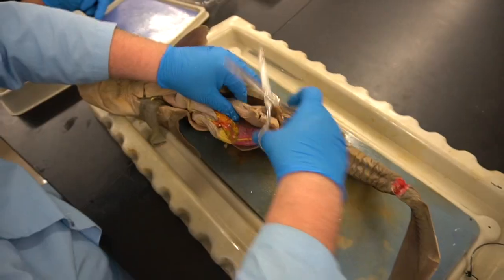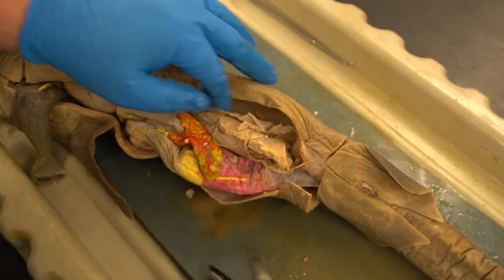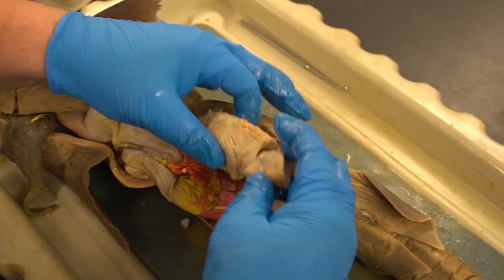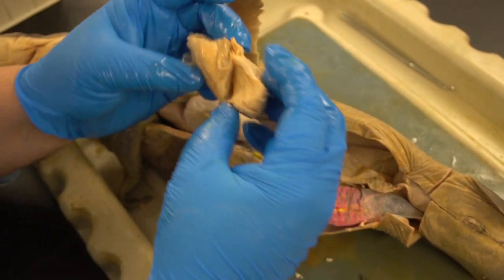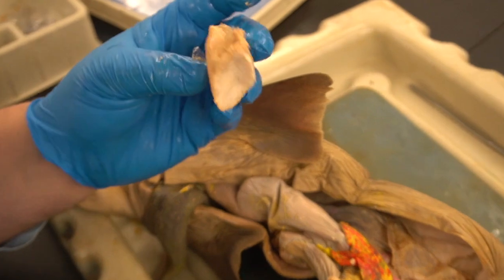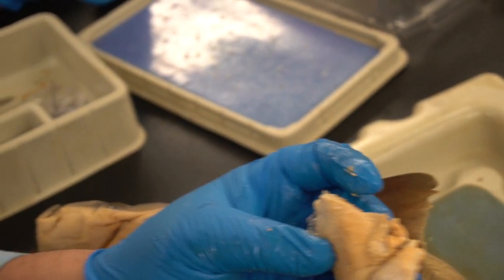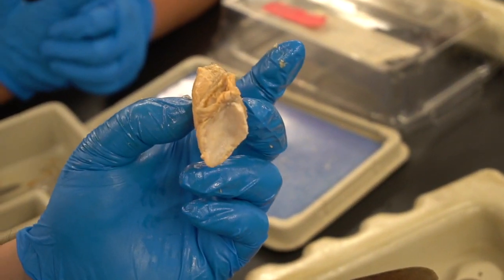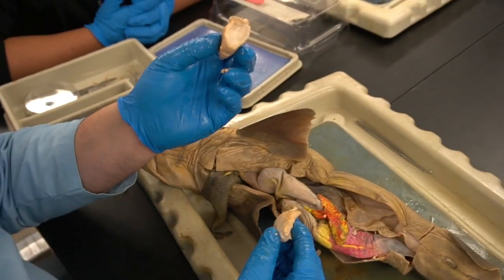All right, so I'm just going to continue to open this uterus. All right, and we'll see if we have anything in development. Well, what we have here, unfortunately, you can start to see how the egg has started to take on a little bit of the form of a body. It was in the process. This was fertilized. It just never made it past an early stage.